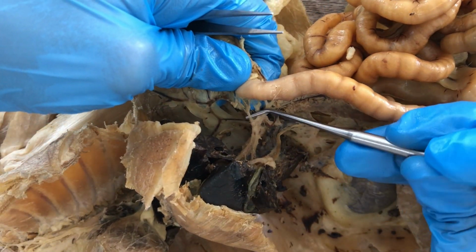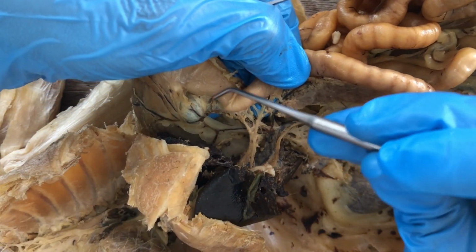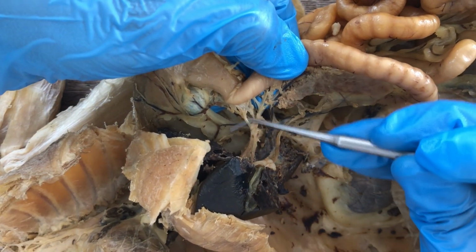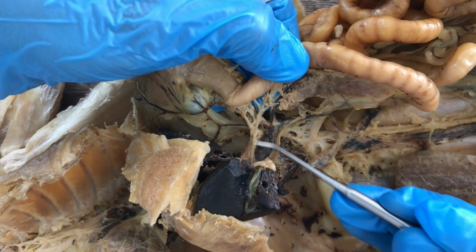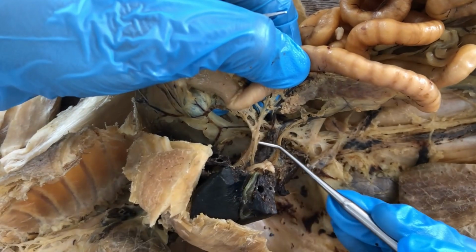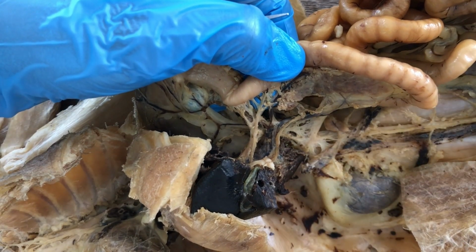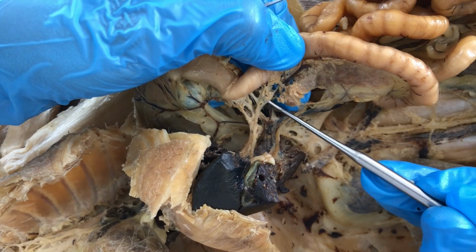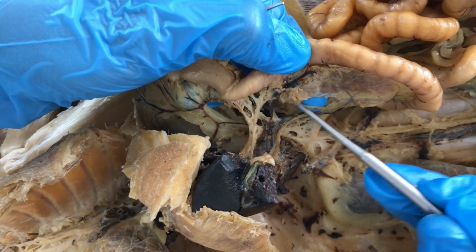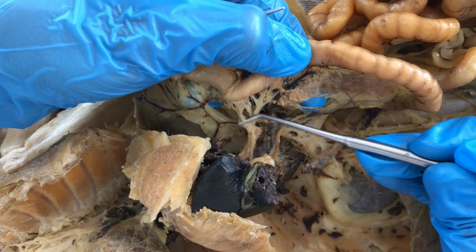And there's also a branch here going to the pyloric portion of the stomach. That's the pyloric artery. So from the gastroduodenal artery come three branches. One going to the pancreas, the anterior pancreaticoduodenal artery. And then there's the pyloric artery.